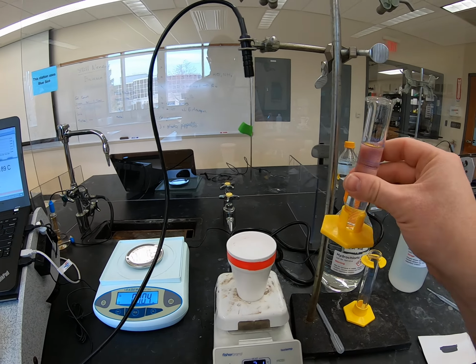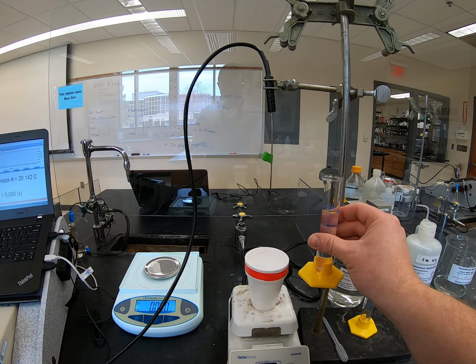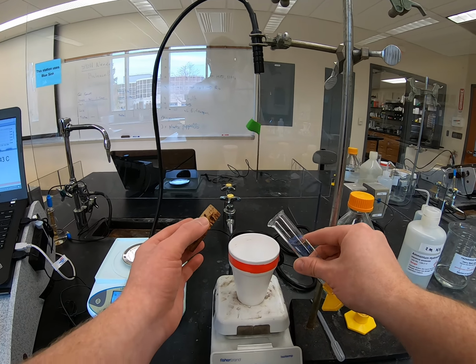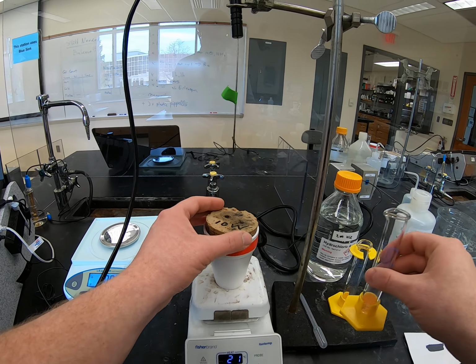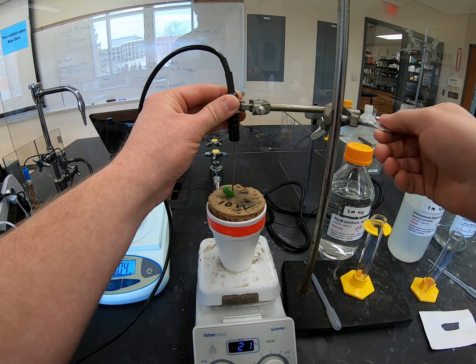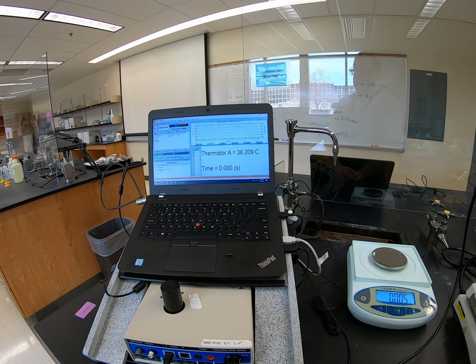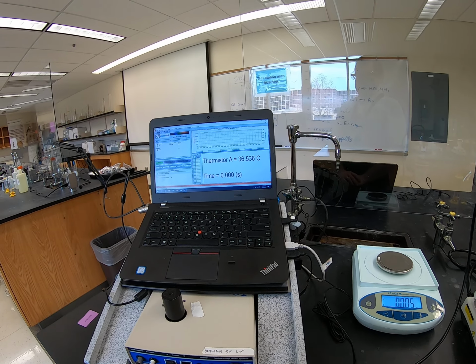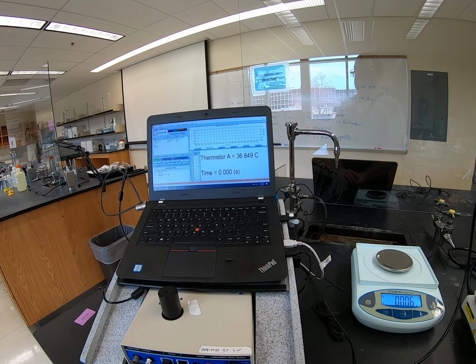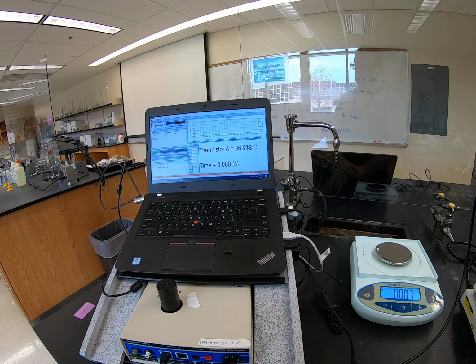And again, the process, I'm going to quickly pour in, actually I'm going to start the stir bar first. There we go. I'm going to quickly pour in the ammonia, cork it, put the thermistor in, and then we're going to watch for our final temperature. Okay, so ammonia in, cork, and lower the thermistor in. Okay, and we glance over here at our temperature, and we see, woohoo, it's cruising on up. And again, we're going to wait for the peak. And wait for the temperature to kind of fall back down once we've reached the peak.